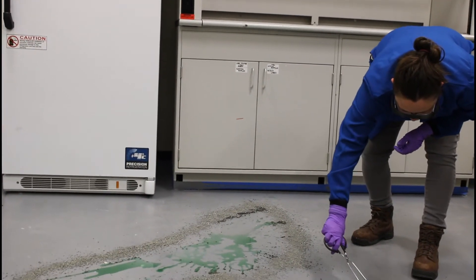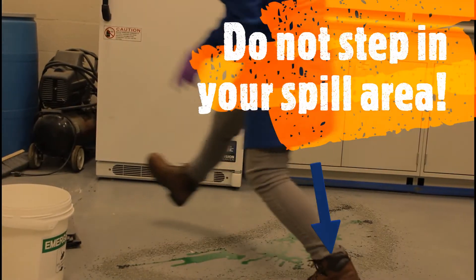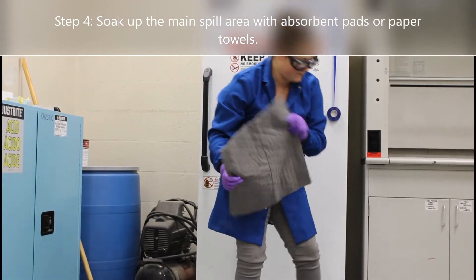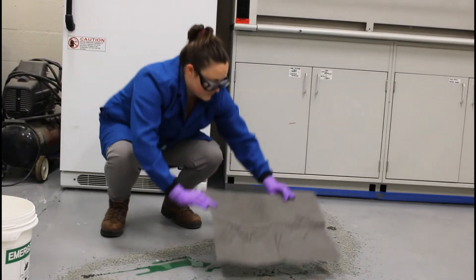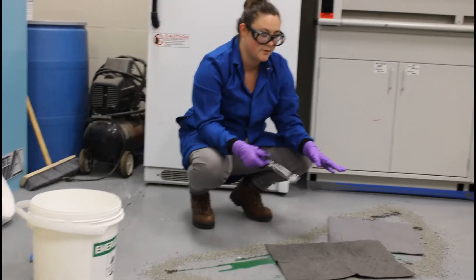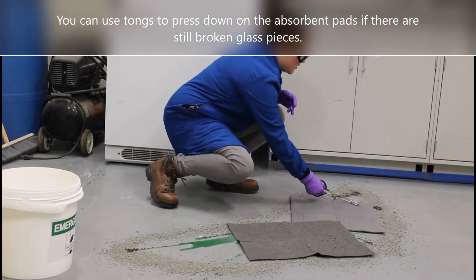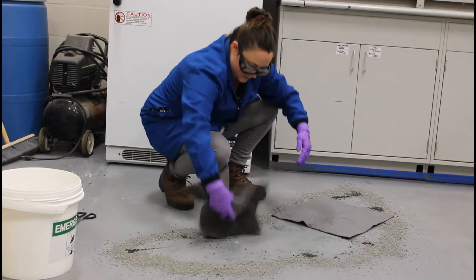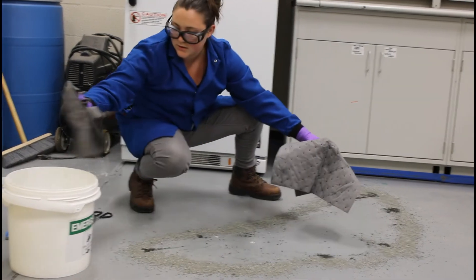Now we're going to soak up the majority of the spill area using absorbent pads from the spill kit. Let those sit. If there are smaller pieces of glass in your spill area, you can use your tools to press down on the pads to make sure they absorb. Try to absorb as much as you can with those materials.